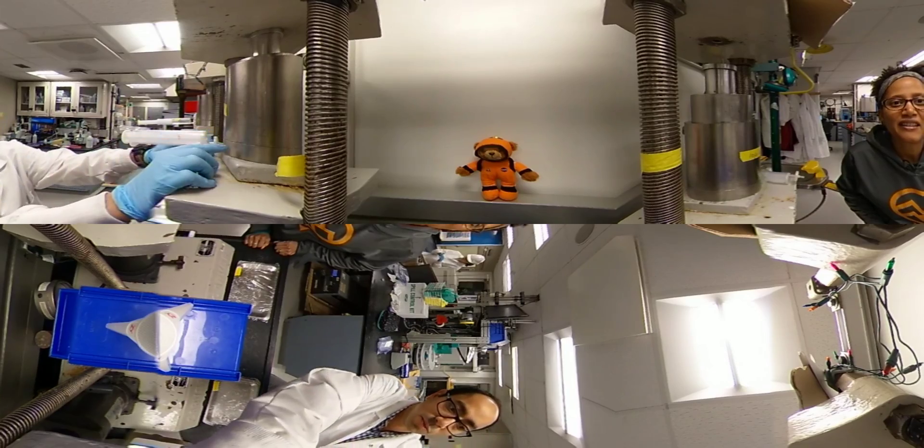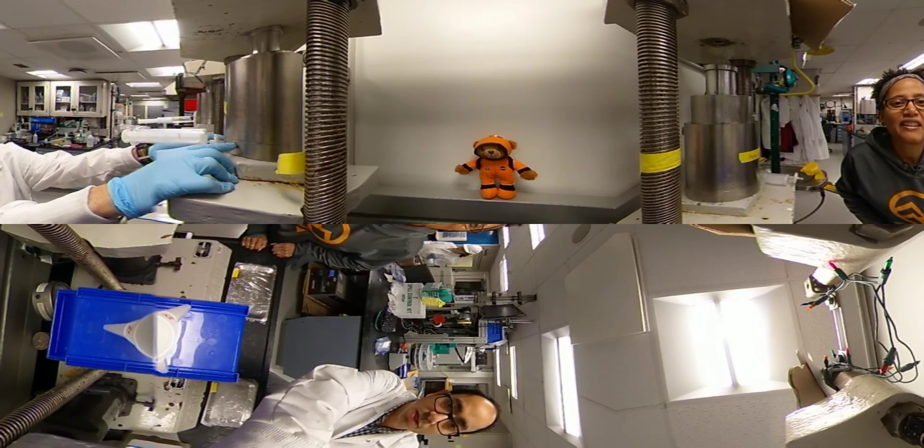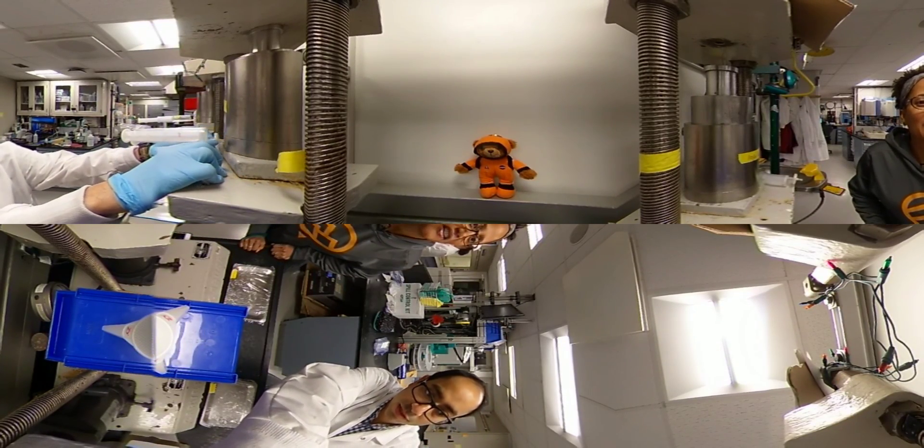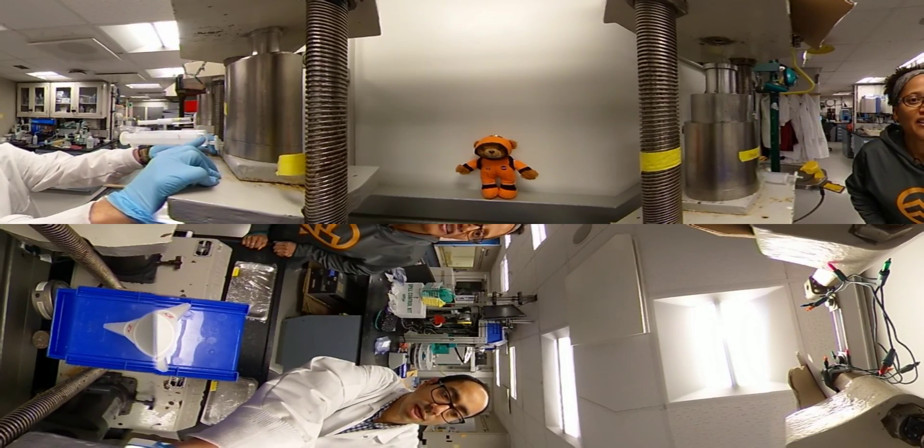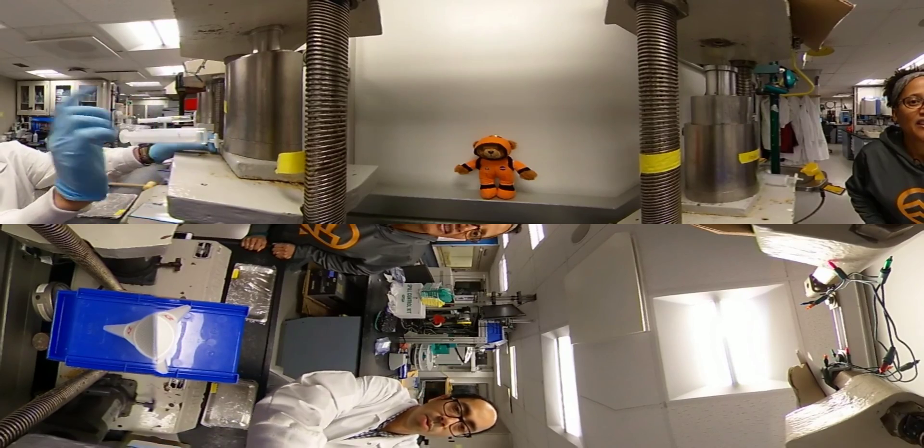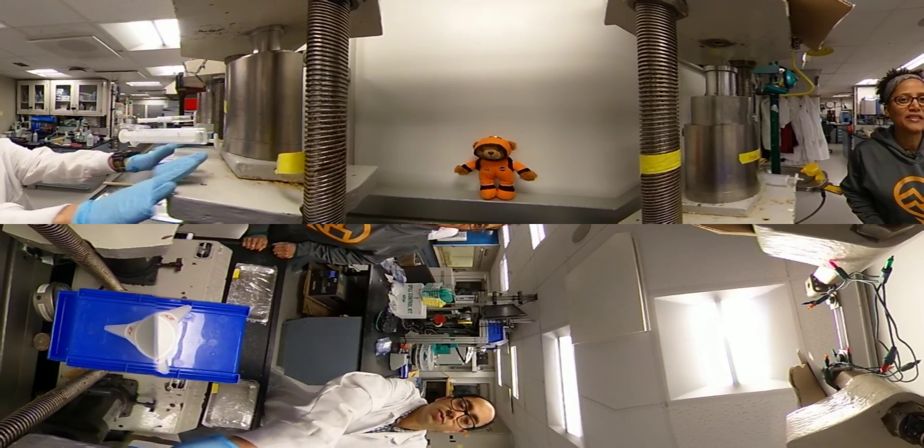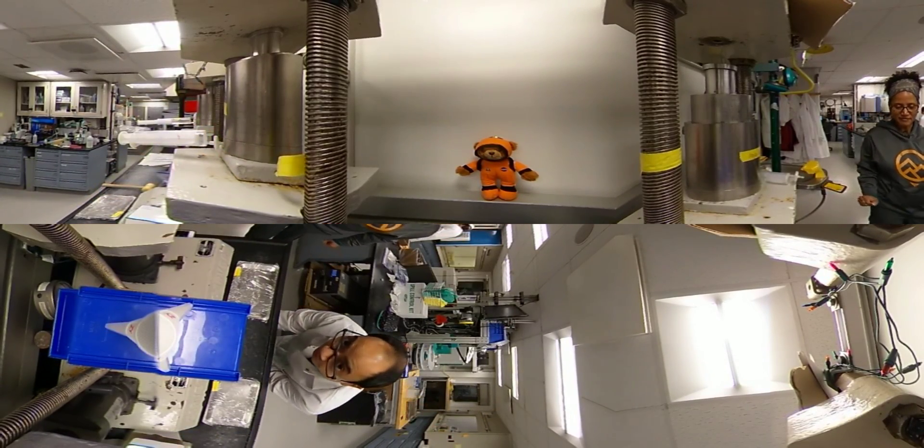Yep, and the sediment will have a lot of particles which then get filtered in this little capsule, which is a filter, and get collected in the syringe. This is our clean pore water that we're going to use for analysis. So here it goes again.